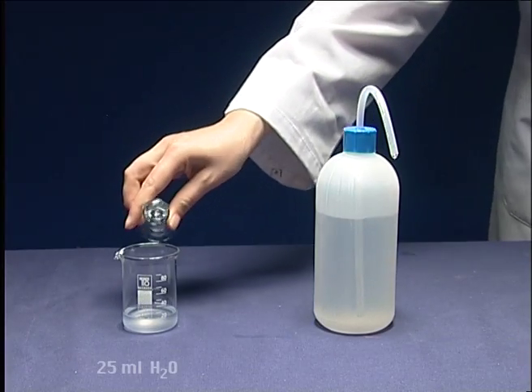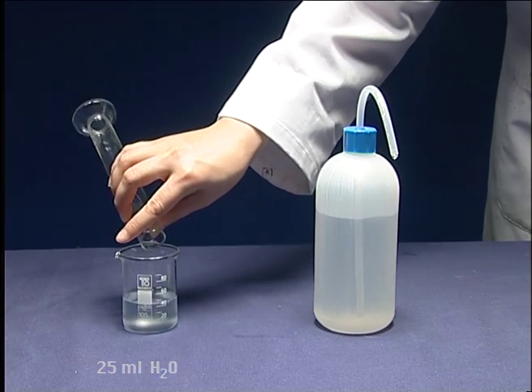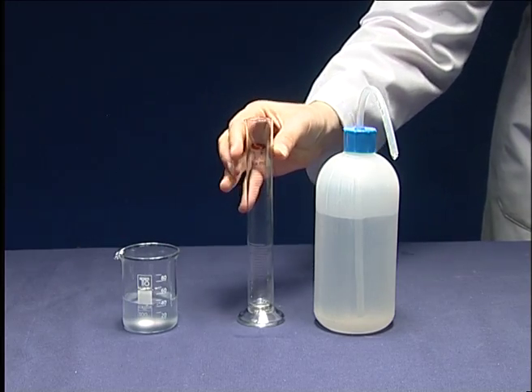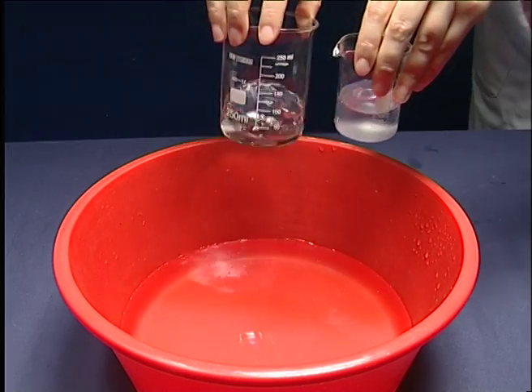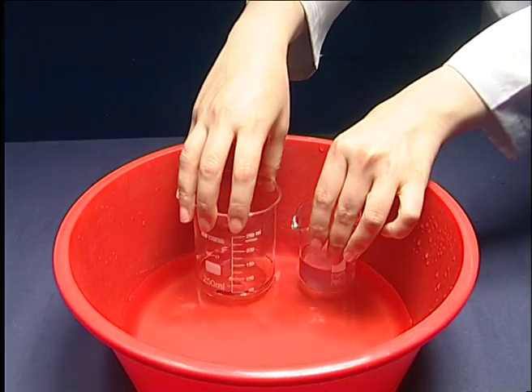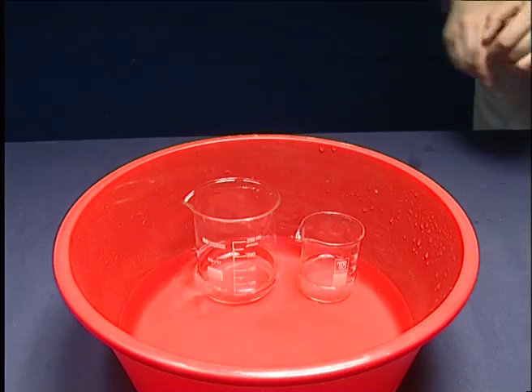Dilute the solution by using 25 milliliters of water. Stir these two beakers and keep the beakers in the water bath for 10 minutes until the temperature reaches equilibrium.